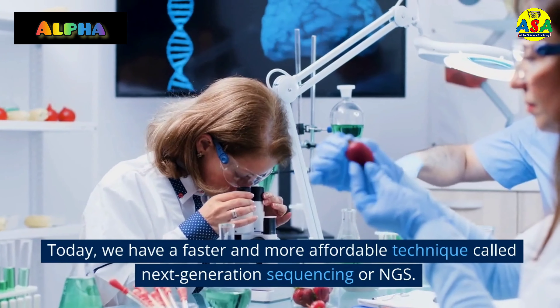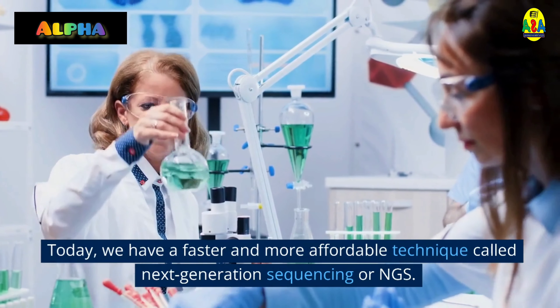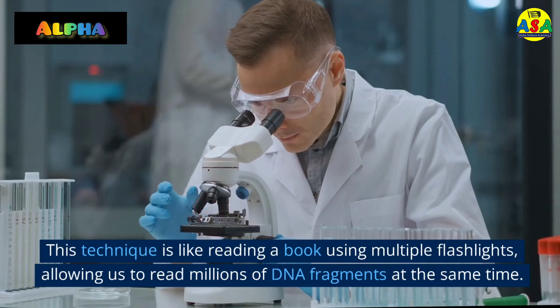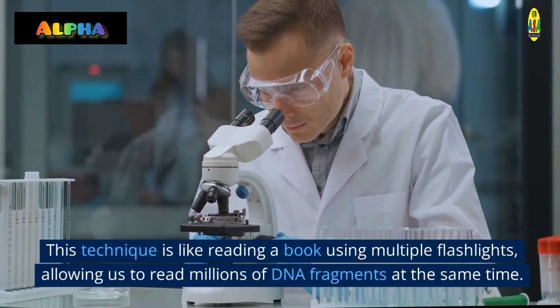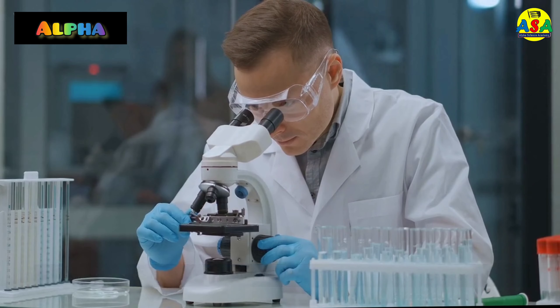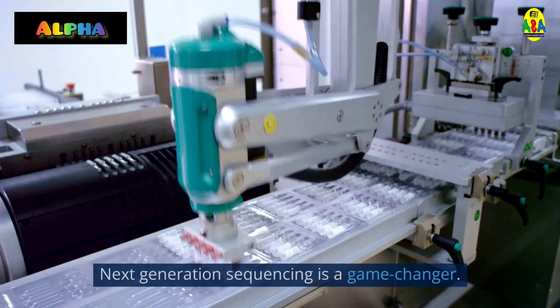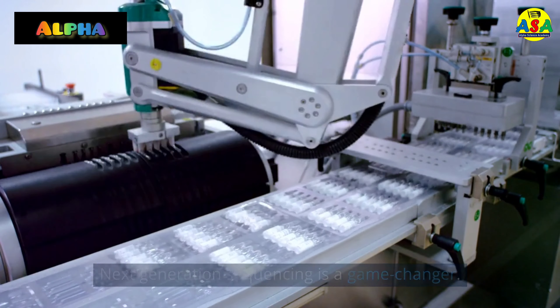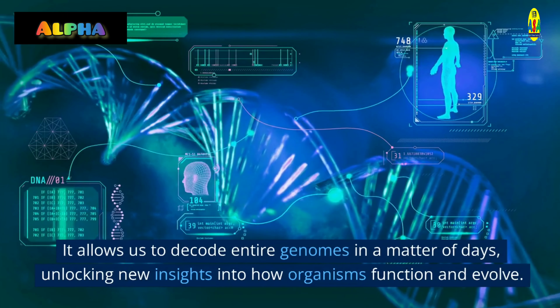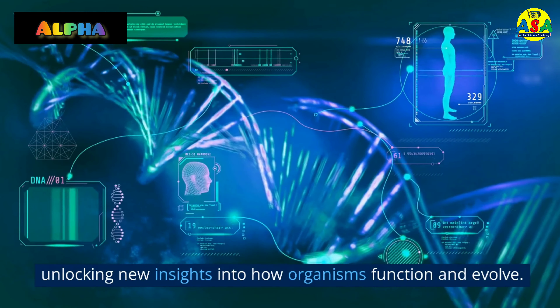Today we have a faster and more affordable technique called Next Generation Sequencing, or NGS. This technique is like reading a book using multiple flashlights, allowing us to read millions of DNA fragments at the same time. NGS is a game changer — it allows us to decode entire genomes in a matter of days, unlocking new insights into how organisms function and evolve.